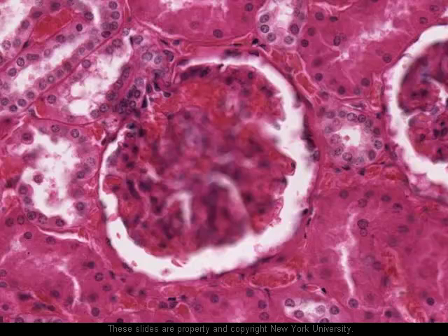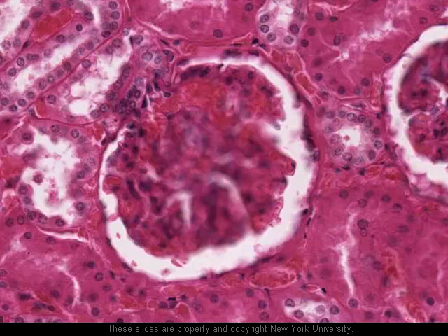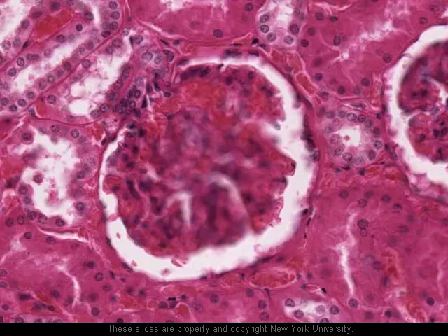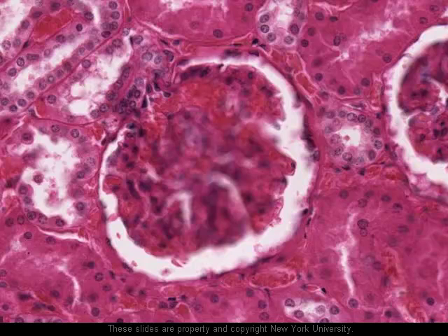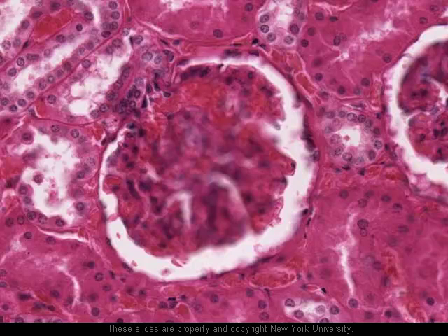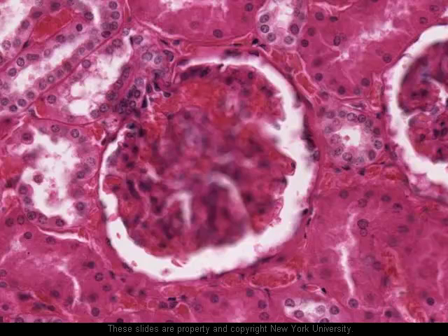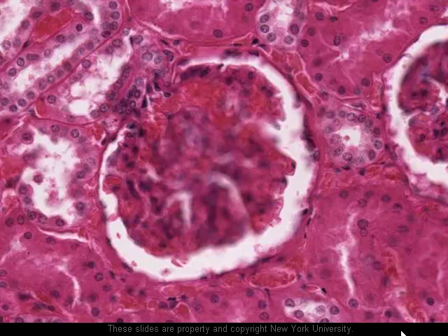And then we have structures such as this one here, which could be — and are likely to be — a section of the loop of Henle, part of either the thick ascending or descending limb of the loop of Henle.